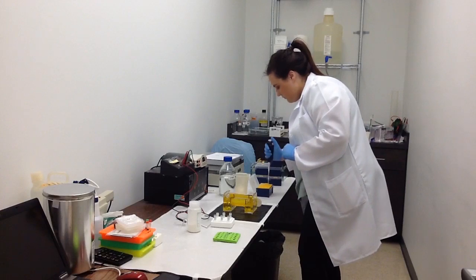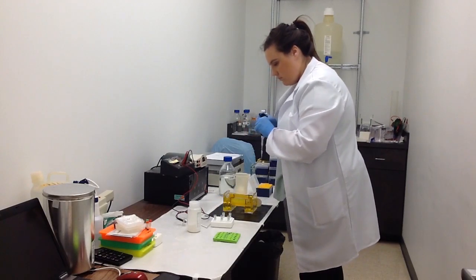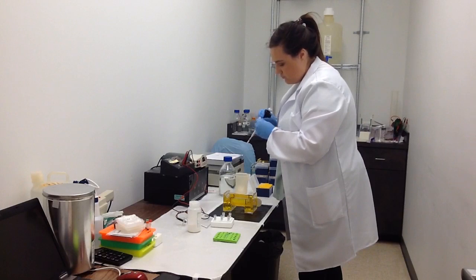Now I'll start loading the ladders into the gels. Normally the ladder would go in the first, middle, or last lanes in the gel.